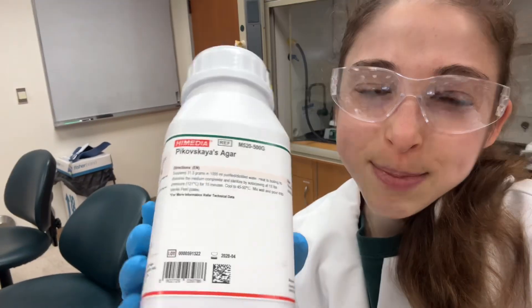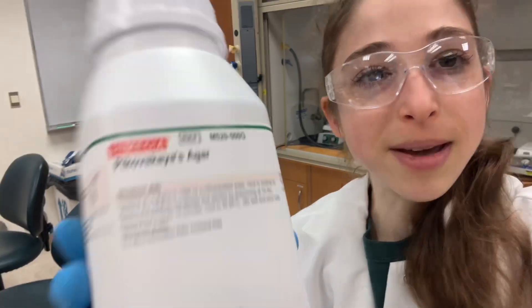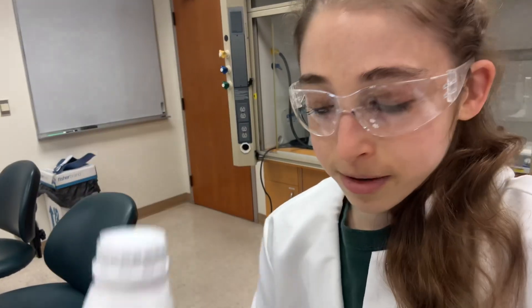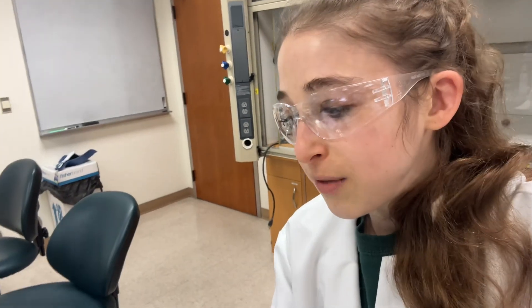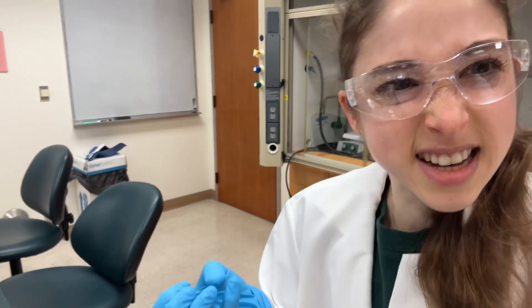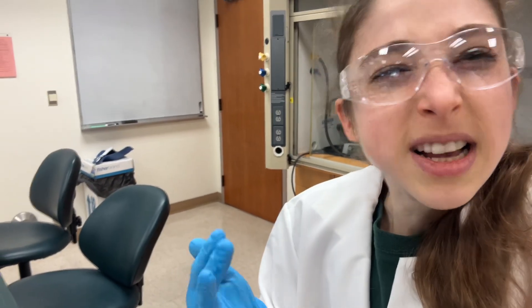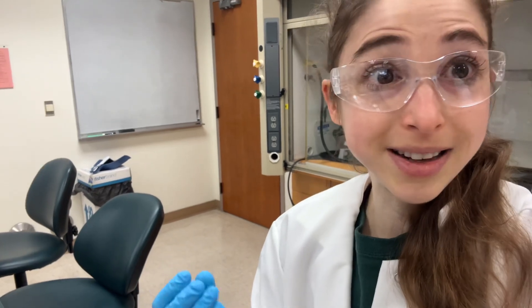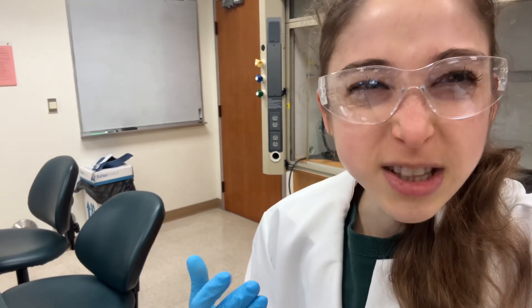What's really special about this particular agar is that it contains calcium phosphate — phosphate in an inaccessible form, similar to the inaccessible form of phosphate that you find in soil.